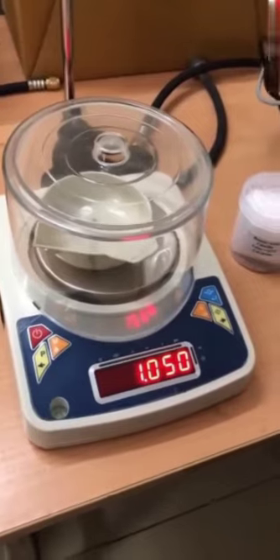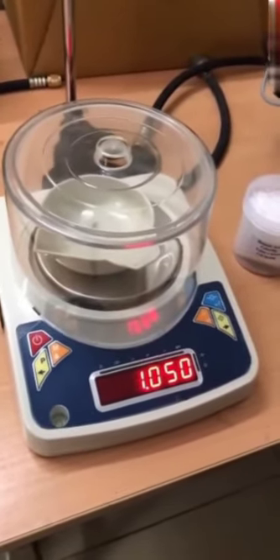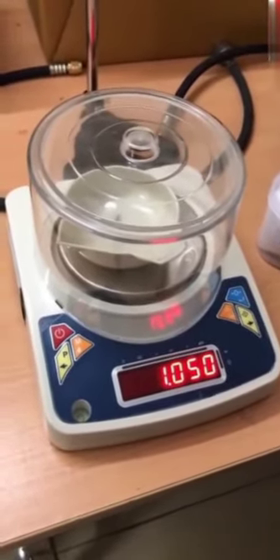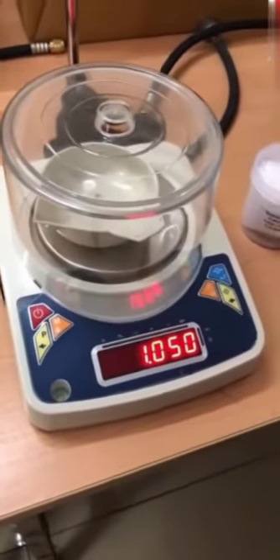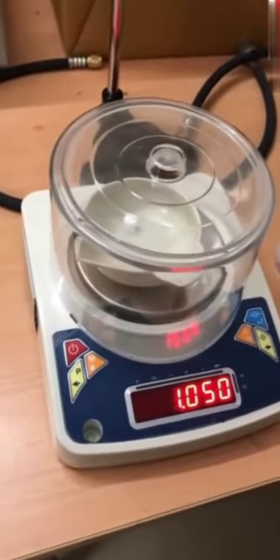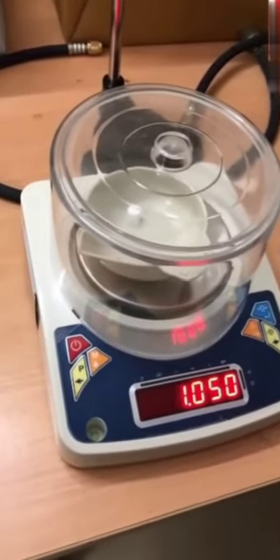So this way, weighing a powder sample is very easy. Suppose we take an unmeasured value of benzoic acid and then make the pellet, and if it is more, we have to scratch it off; or if it is less, we have to do it again. So this way our time is saved. The weight of that pellet is 1.050. This is how the pellet is made. We are showing this for benzoic acid and the same procedure is followed for other samples also.